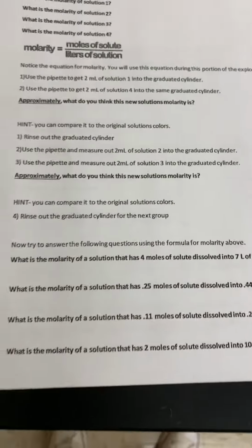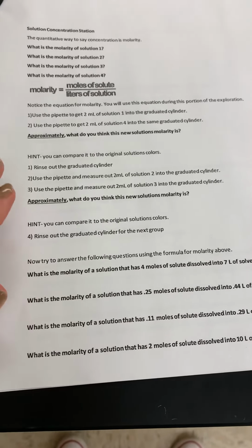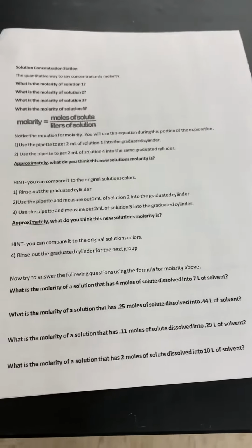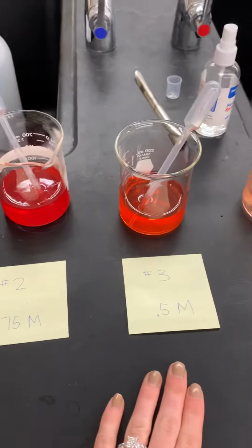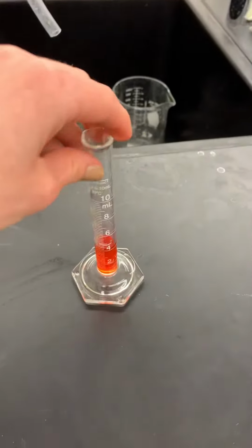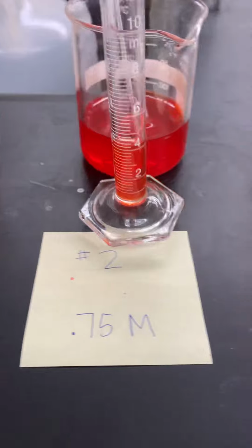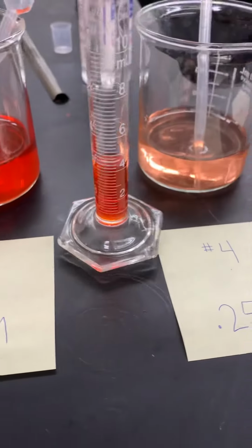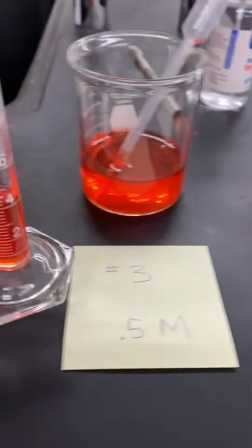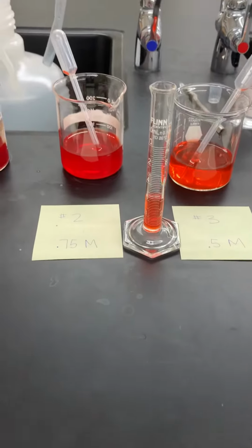All right, the next part of your lab is this next part that's asking you now to do it with 2 milliliters of number 2 and 2 of number 3. So we're doing these ones by putting them together, and this is the solution that you get over here. Okay, so again, I'll hold these up next to these so that hopefully you can see and decide what color it might be close to, what molarity it might be close to or in between. All right, go back and pause it if you need to.